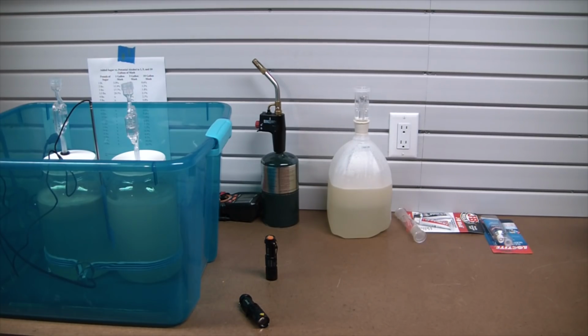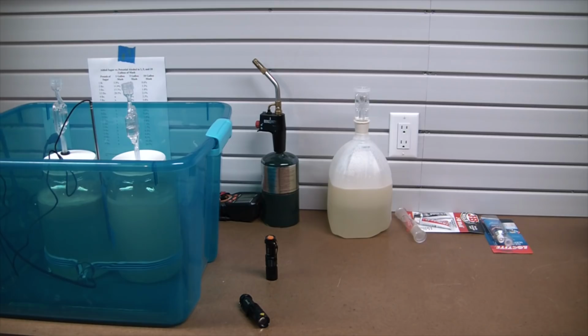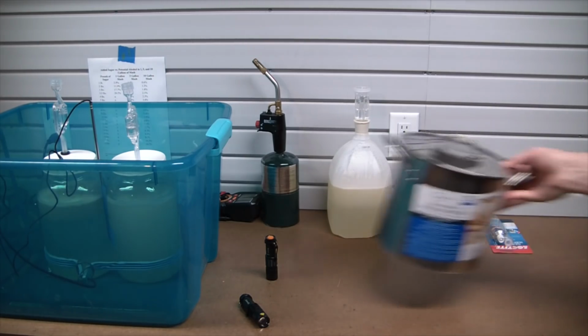I do have a standard chemistry still, which has a 1 liter boiling flask and a 500 milliliter receiver. That would take quite a few runs to process 2.5 gallons of sugar wash. I'd be there for quite a few days trying to get that ethanol. So what I'm trying to do today is build a much larger still.